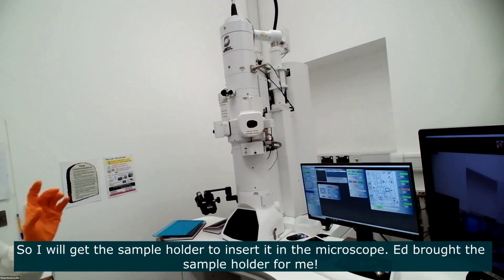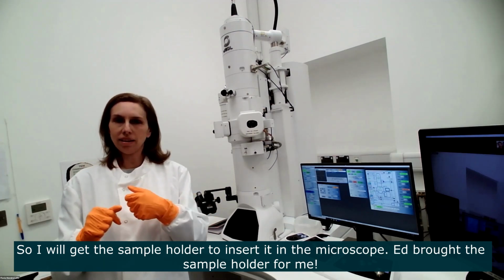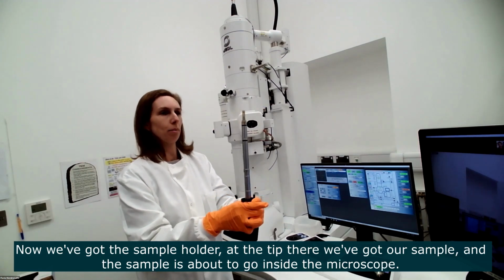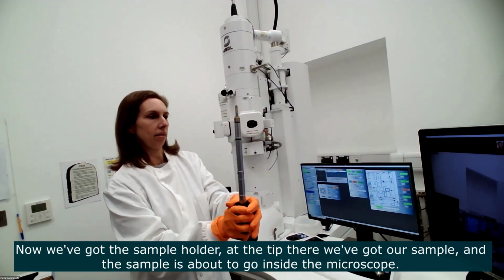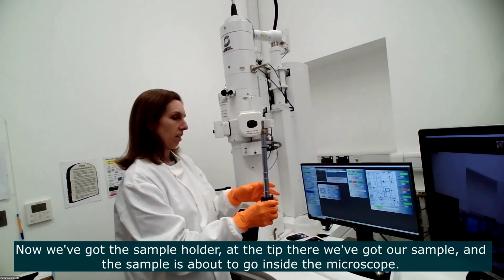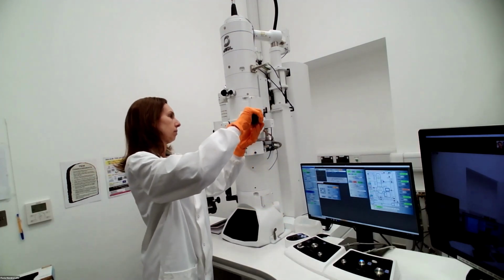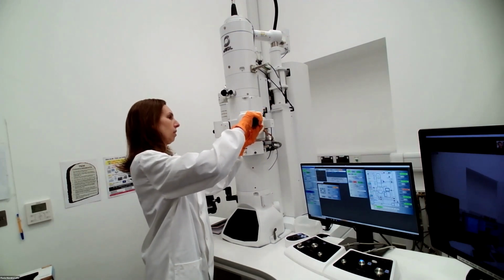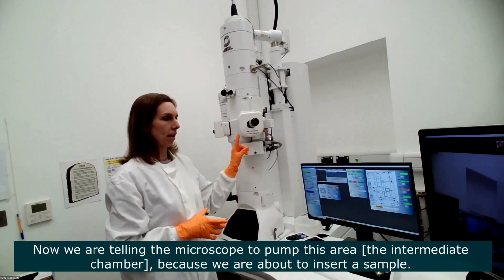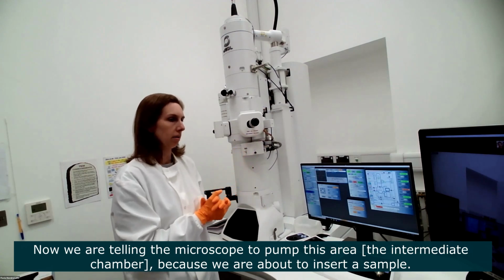Okay, so I will get the sample holder and then bring it here to insert the sample. Oh, excellent. Ed has brought the sample holder for me. Now we have the sample holder, and at the tip we have our sample, which is going to go inside the microscope. Let's put the sample in. And now we are telling the microscope to pump this area because we are about to put a sample inside.